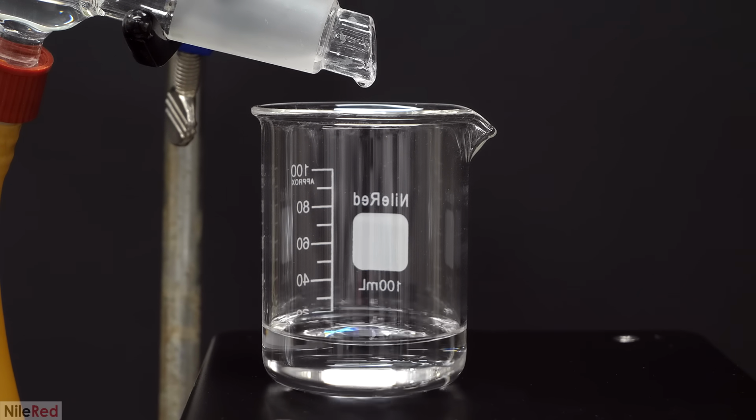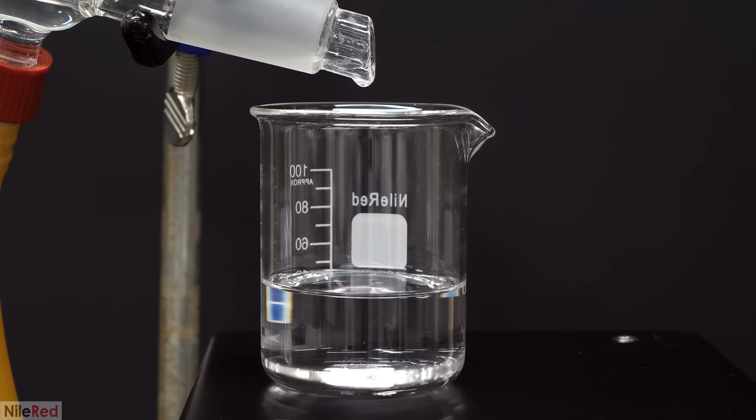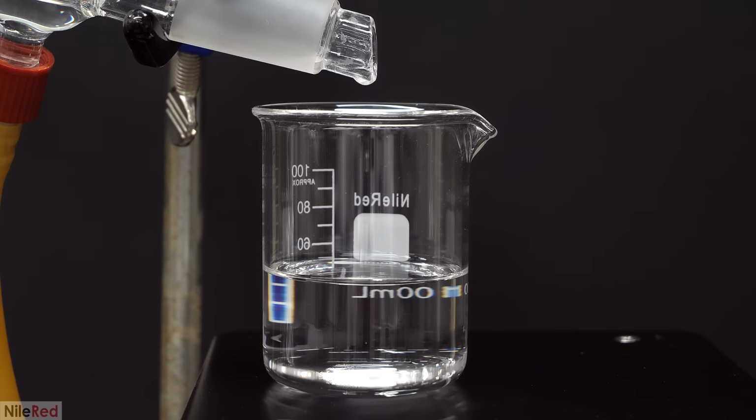probably around 85%. Like before though, there was still a lot of water in the boiling flask, and the amount of ethanol that was in it was constantly decreasing. So the stuff that I was collecting slowly got less concentrated, and the temperature also slowly increased. As this happened, higher boiling point side products were being carried over with the ethanol, and it was changing the taste. This portion is near the end of the distillation, and it's commonly known as the tails.